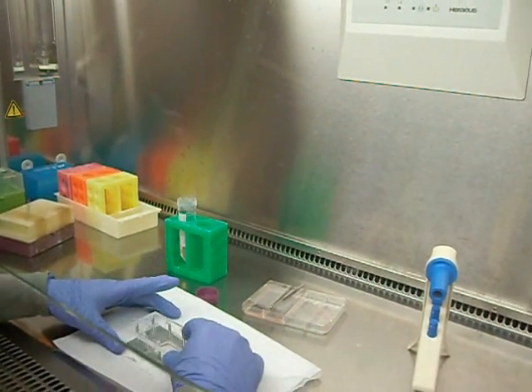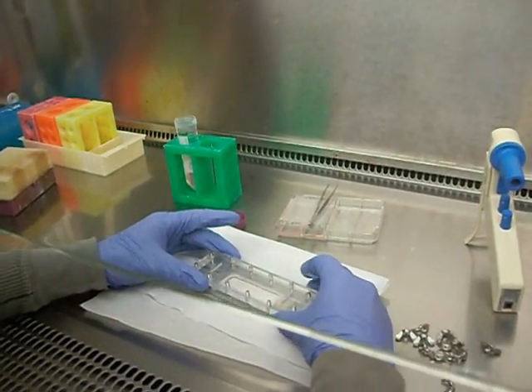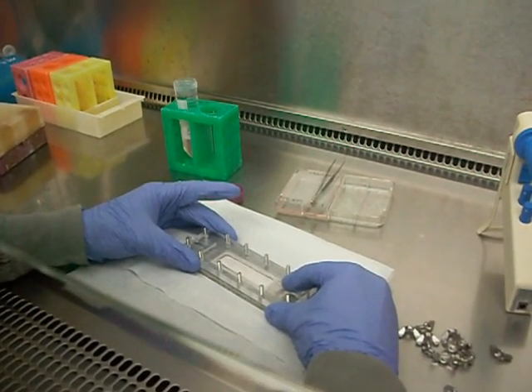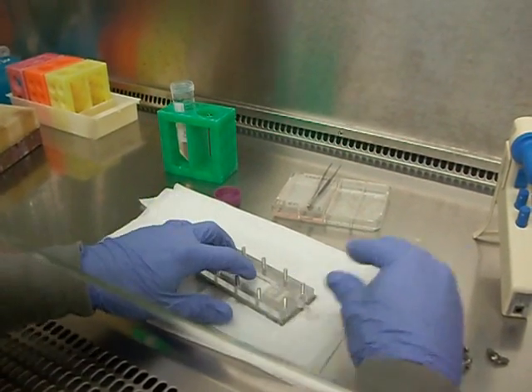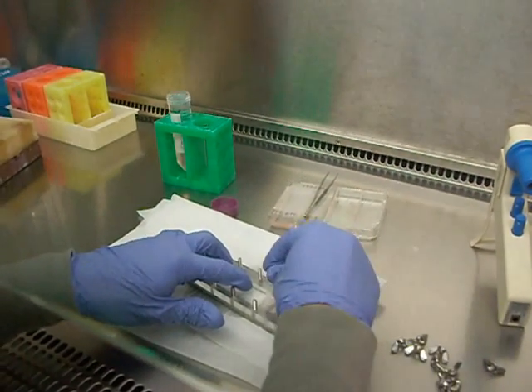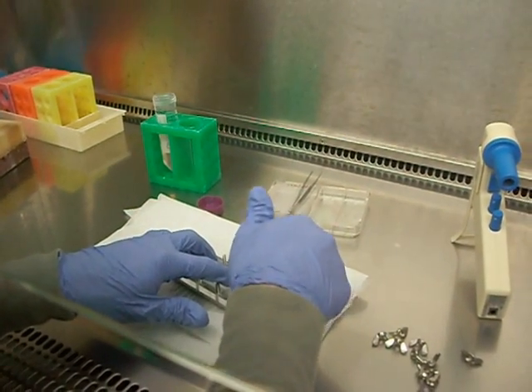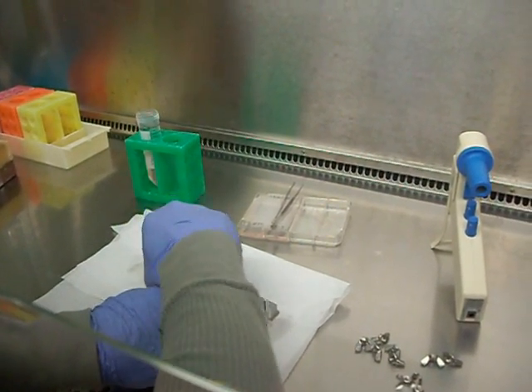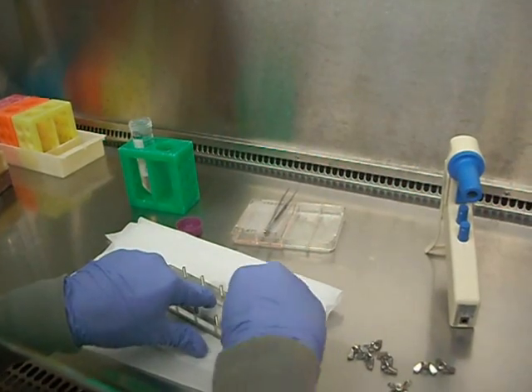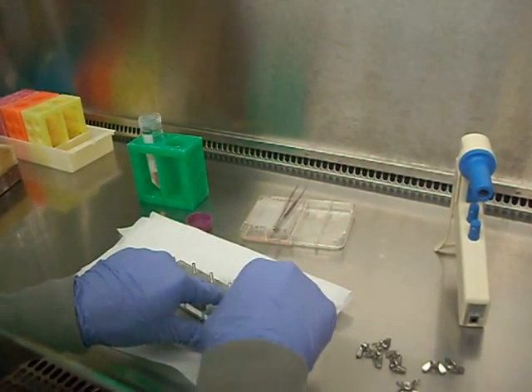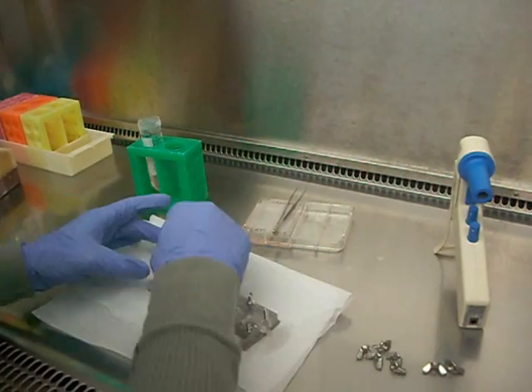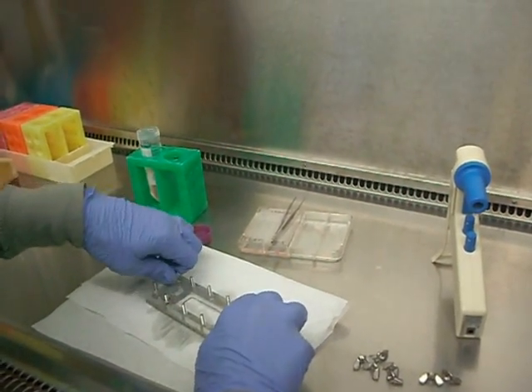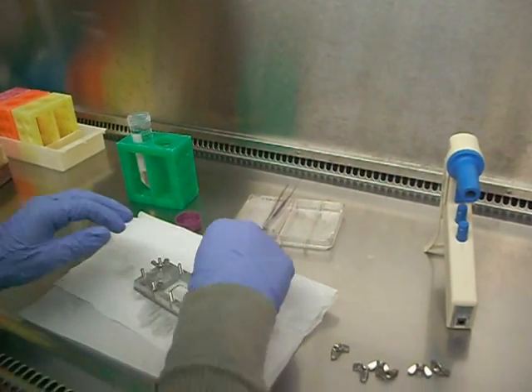And now we're ready to add the top part of the chamber. What you want to do is you want to get it ready and quickly go from one side to the next or kind of quickly push it all down and hold it down while you add a few of the wing nuts. And just finish adding the wing nuts and you're ready to go.